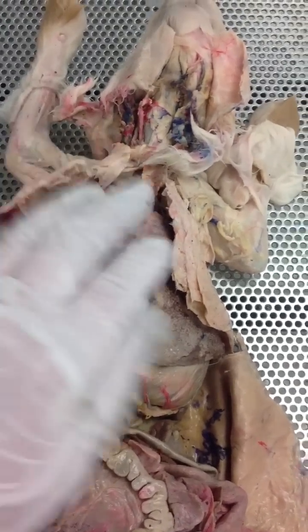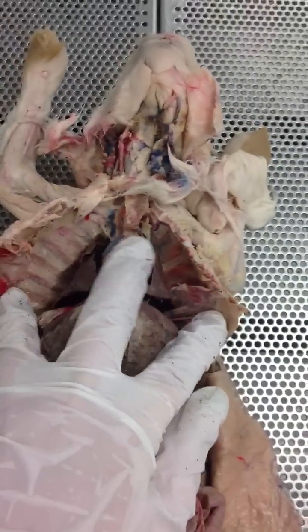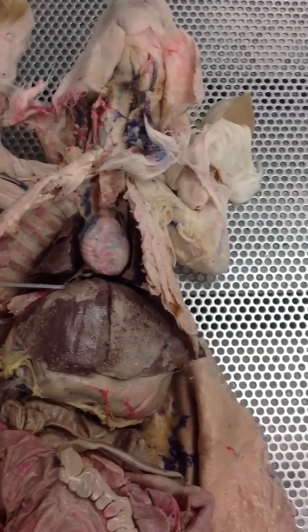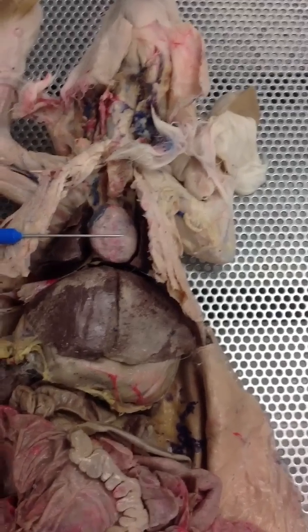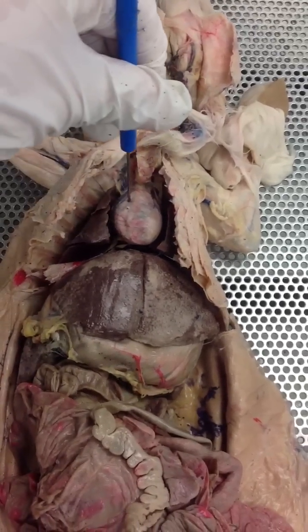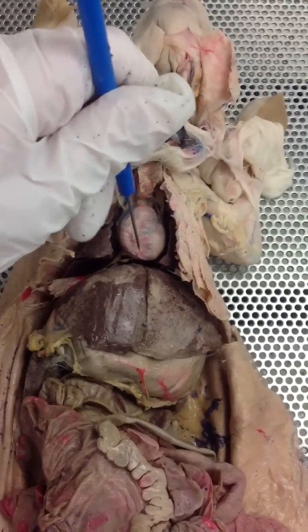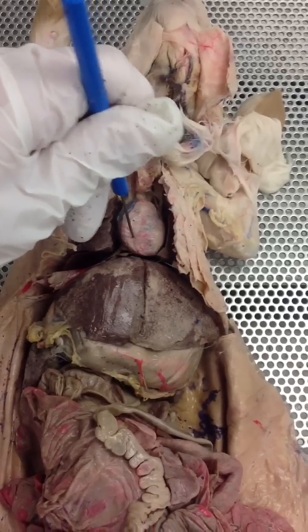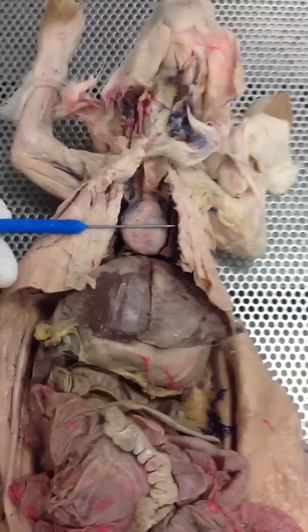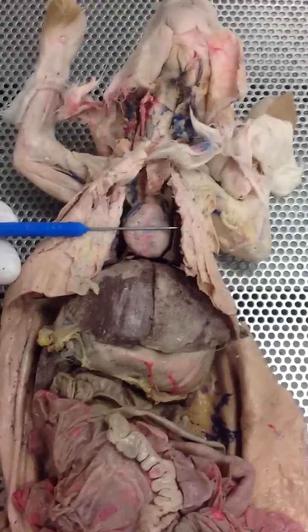This is going to be the internal organs of the rabbit. Start up here — this is going to be the pericardial sac. If I were asking you on the practical to identify the pericardial sac versus an atrium or ventricle, I would stick the needle straight down through, implying I'm asking for the right atrium or right ventricle. If I stick the needle through this way, it's implying I'm asking for the actual pericardial sac — the internal organ versus the part of the circulatory system.